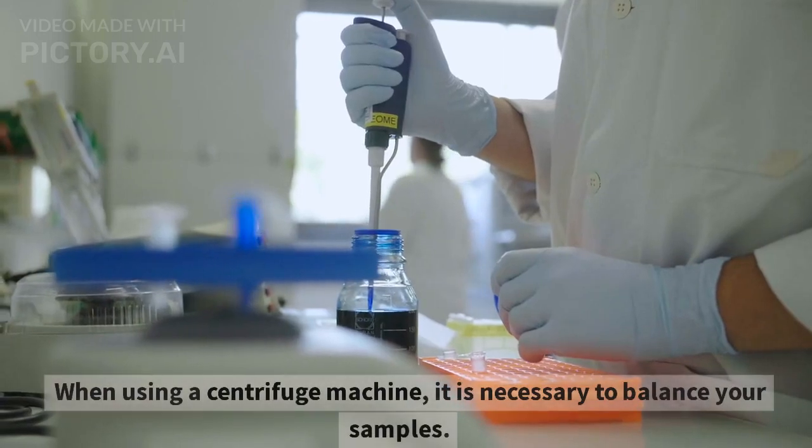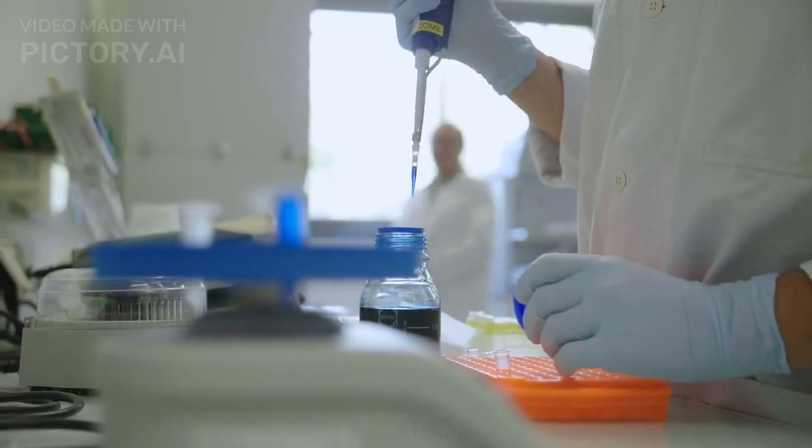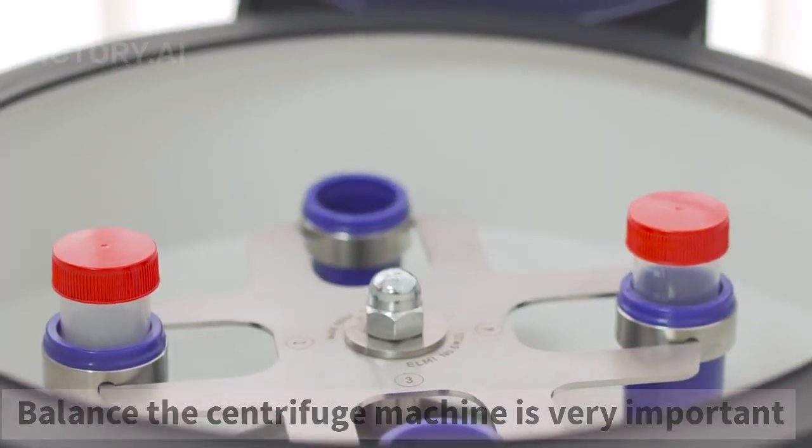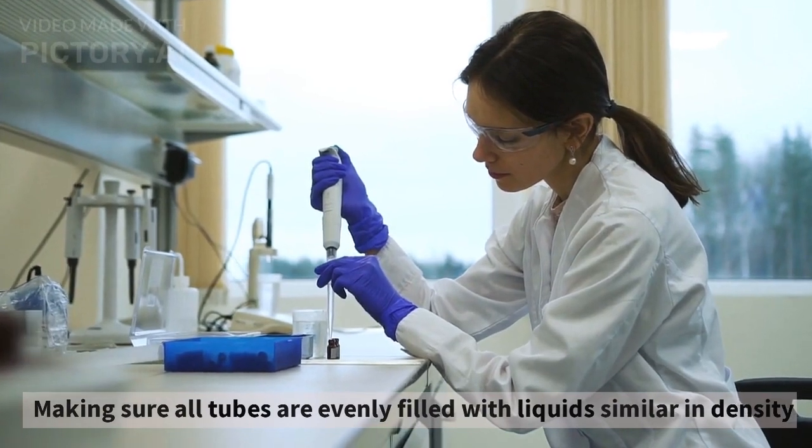When using a centrifuge machine, it is necessary to balance your samples. Balancing the centrifuge machine is very important. Make sure all tubes are evenly filled with liquids similar in density.